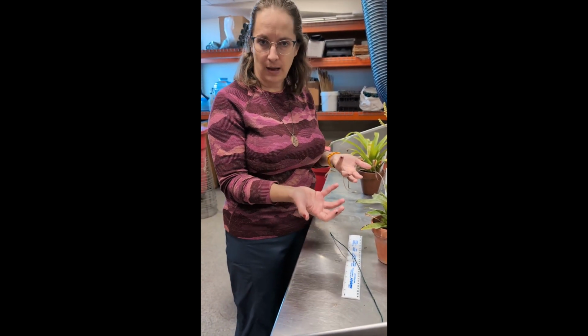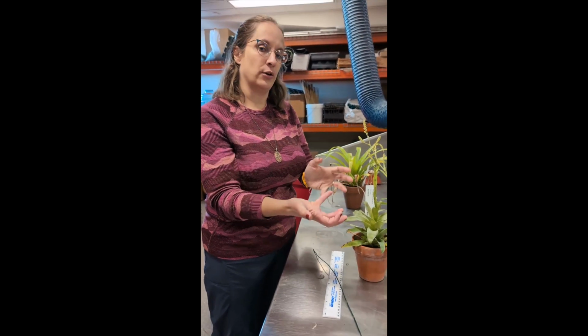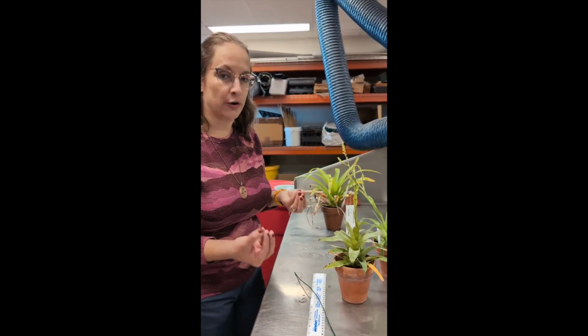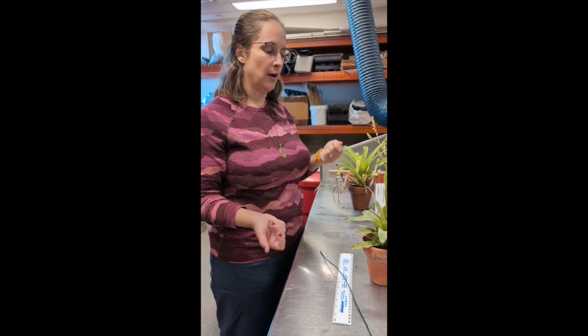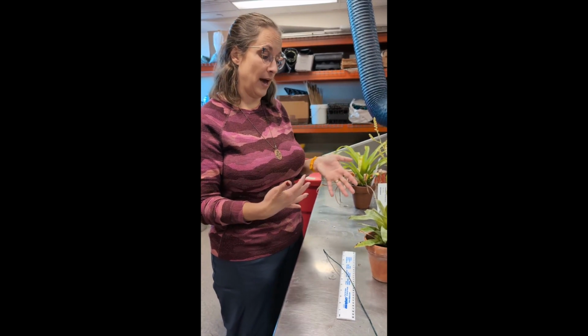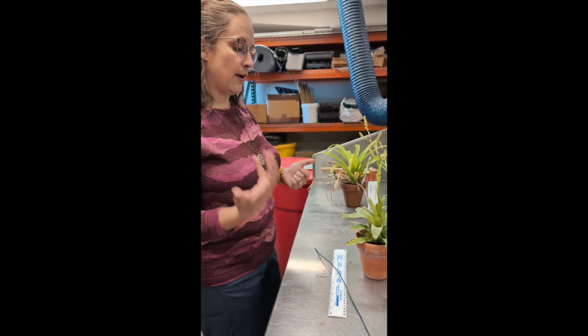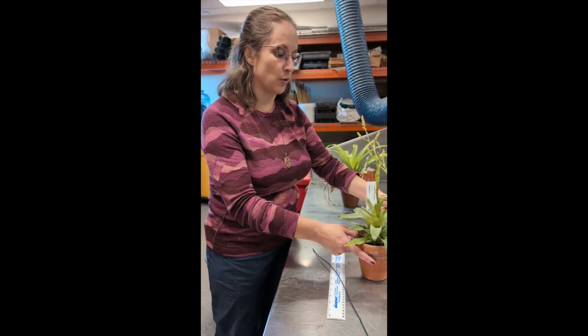It's going to weigh a lot more, which would make us in error think this is a much bigger plant, when really it's just water weight. So when you're weighing plants that are alive, just be aware of variation that might not be so meaningful like that. So we developed some other ways of tracking and measuring how these plants grow over time.